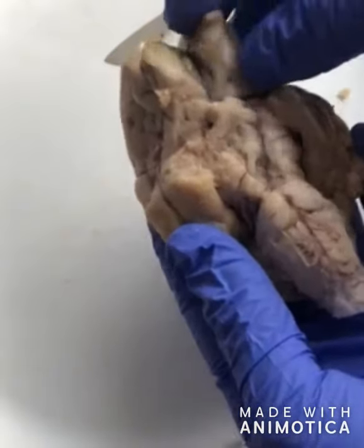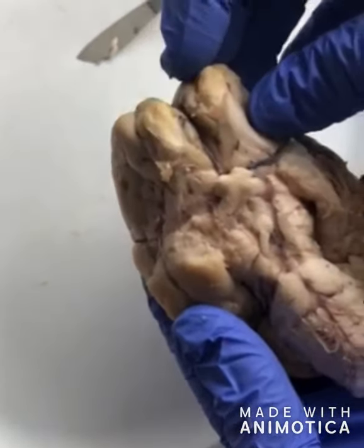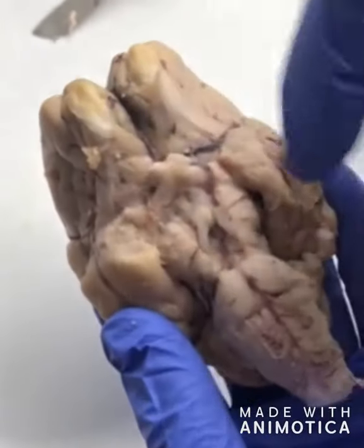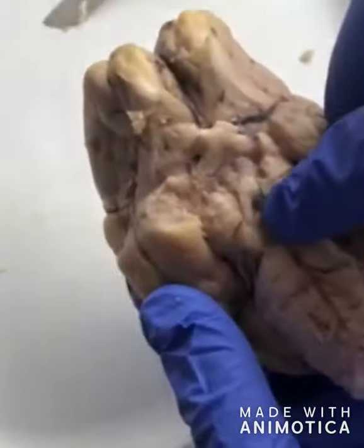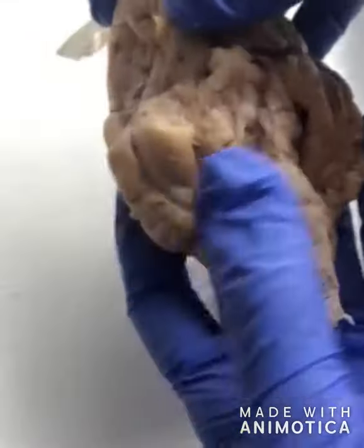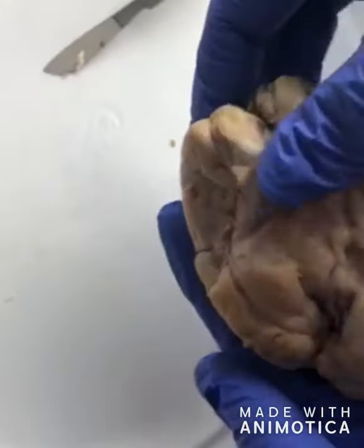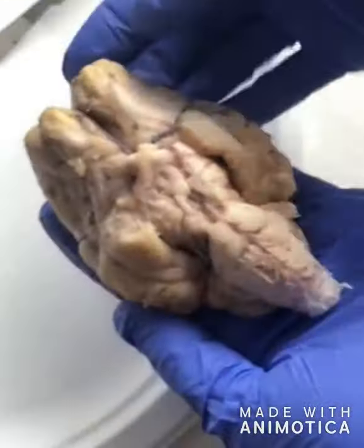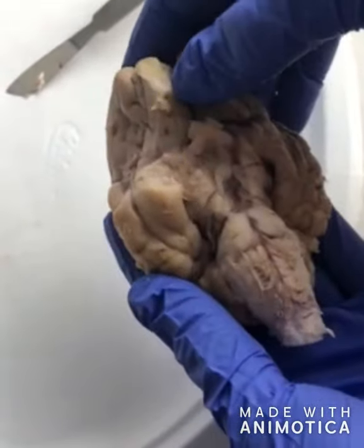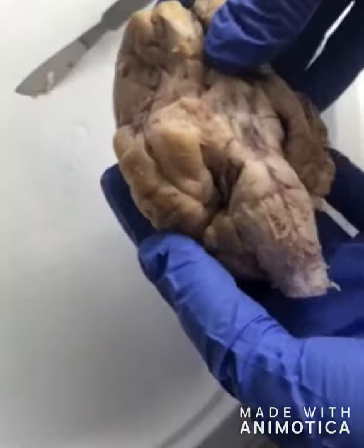So there are 12 cranial nerves. These ones here are the olfactory nerves. They control smell. And then these here where the optic chiasm was, that's for vision. And then I believe this one, right there, is the oculomotor, which does eye movements. And then there's several others, some for jaw muscles, face muscles, hearing, taste, neck movements, tongue movements, and then the vagus nerve, which controls the internal organs. It's the largest of the cranial nerves, and it regulates functions of the organs in the thoracic cavities.